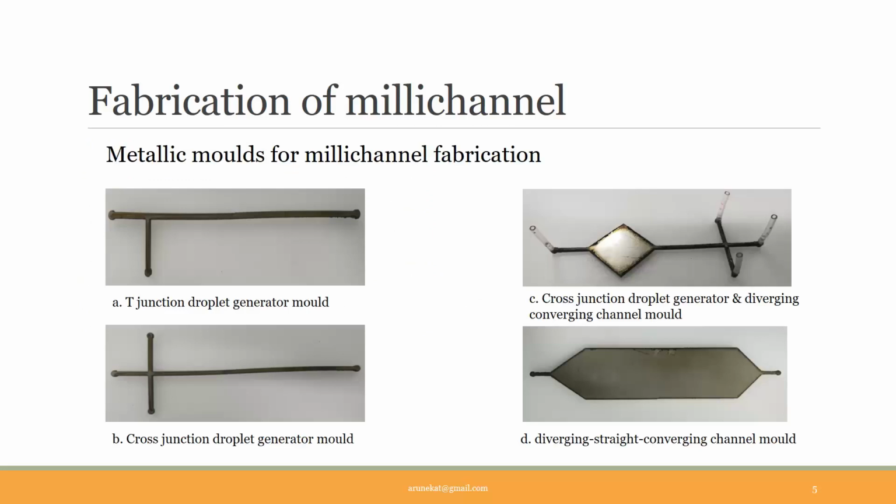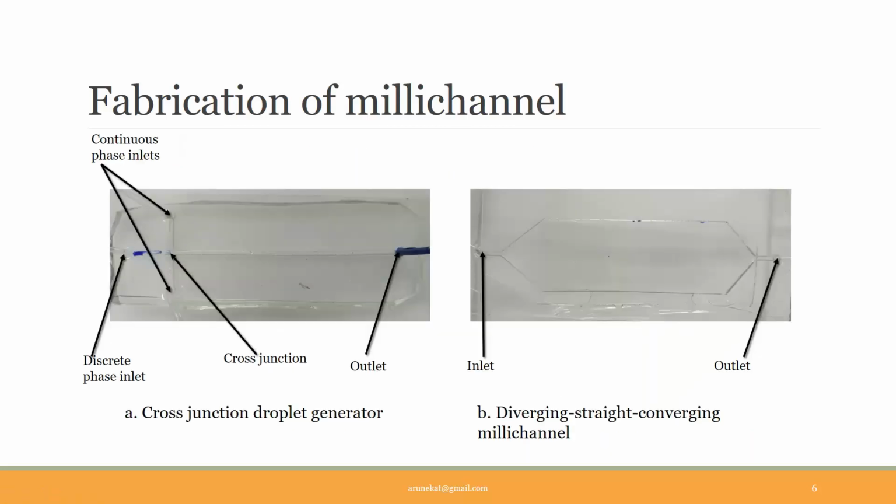In this slide, you can see the images of different molds we use. The first one is for a T-junction droplet generator, and the second one is for a cross-junction droplet generator, and this is the mold of a cross-junction droplet generator and a diverging converging channel, and this is a mold for a diverging straight converging channel. And these are the images of final PDMS leak-proof channels. The first one on the left is a cross-junction droplet generator, and the continuous phase fluid enters through these inlets and discrete phase fluid enters through this inlet. This is the cross junction and this is the outlet. On the right side you can see a diverging straight converging millichannel.